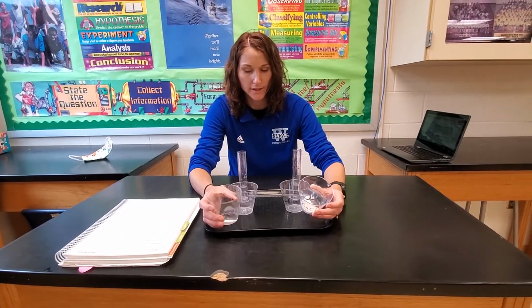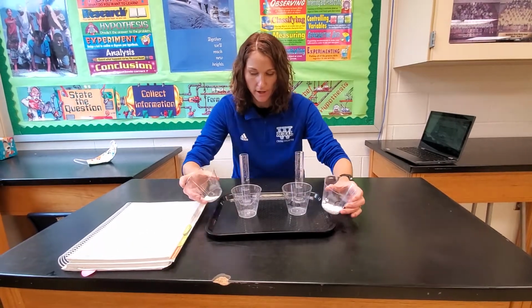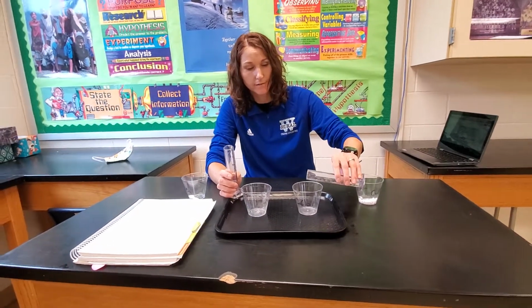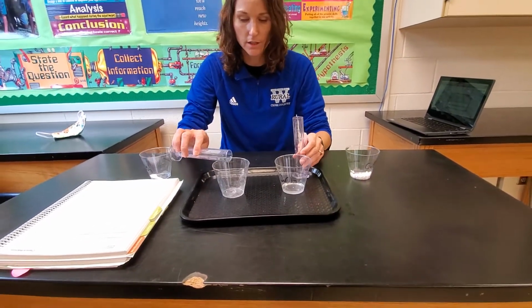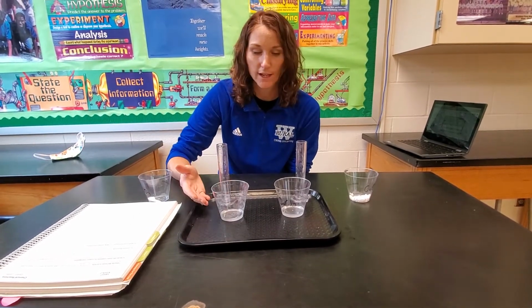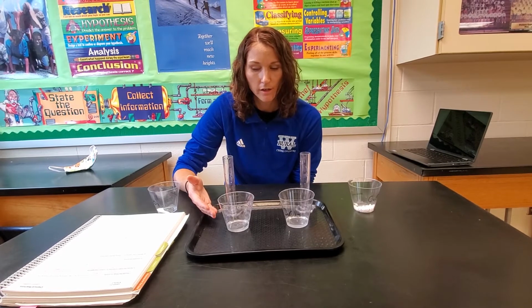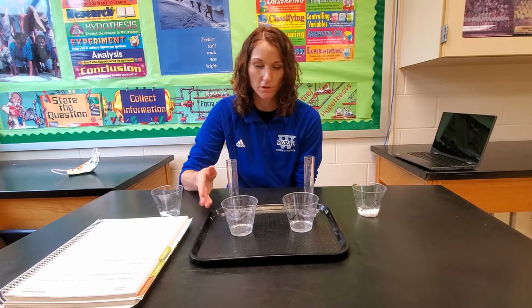so what I did is I mixed these different substances with water, and I dissolved them into water. All right, so I have my 15 milliliters of calcium chloride and my 15 milliliters of sodium carbonate, and I would make my observations again. After they dissolved, they look very similar to one another. They're both clear liquid solutions. I can see through them. It's hard to distinguish which one is calcium chloride and which one is sodium carbonate.